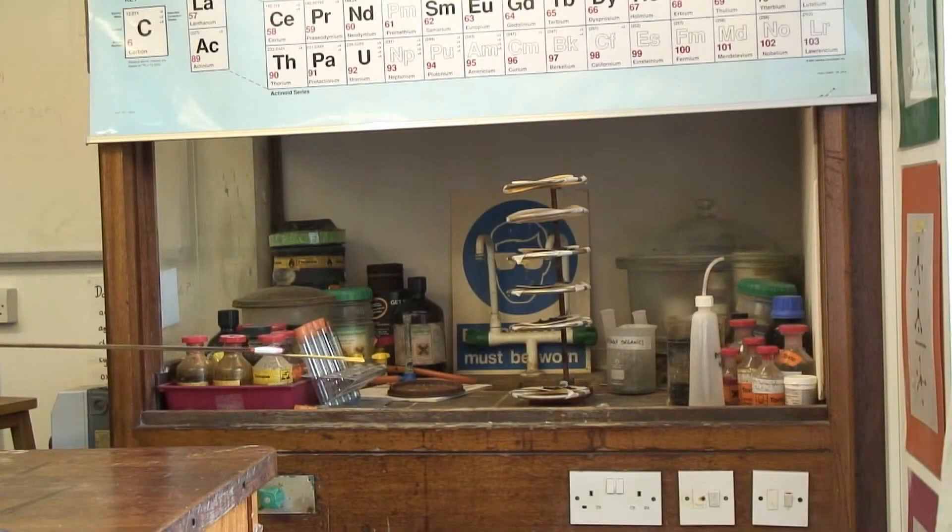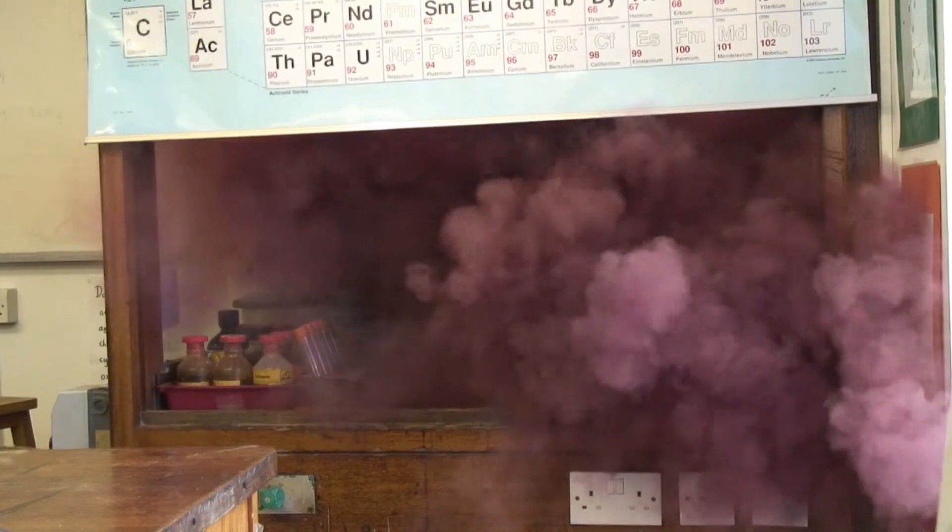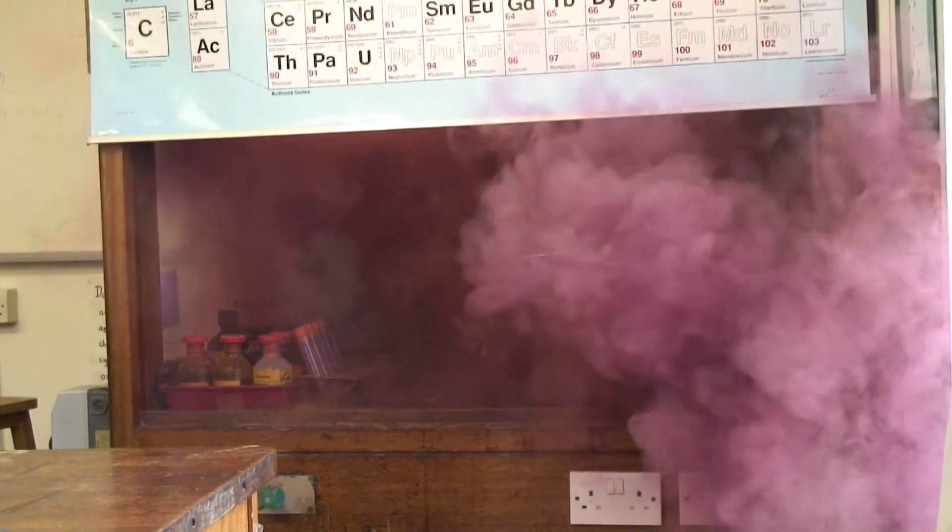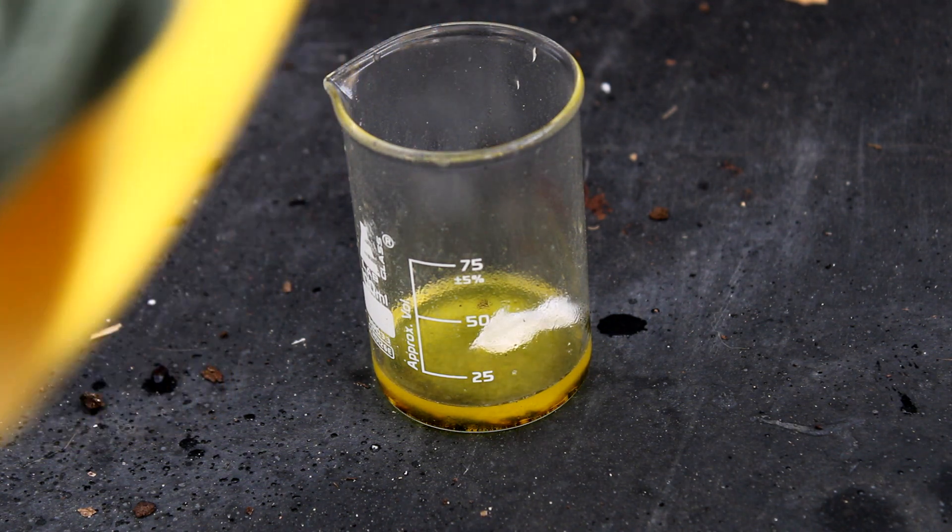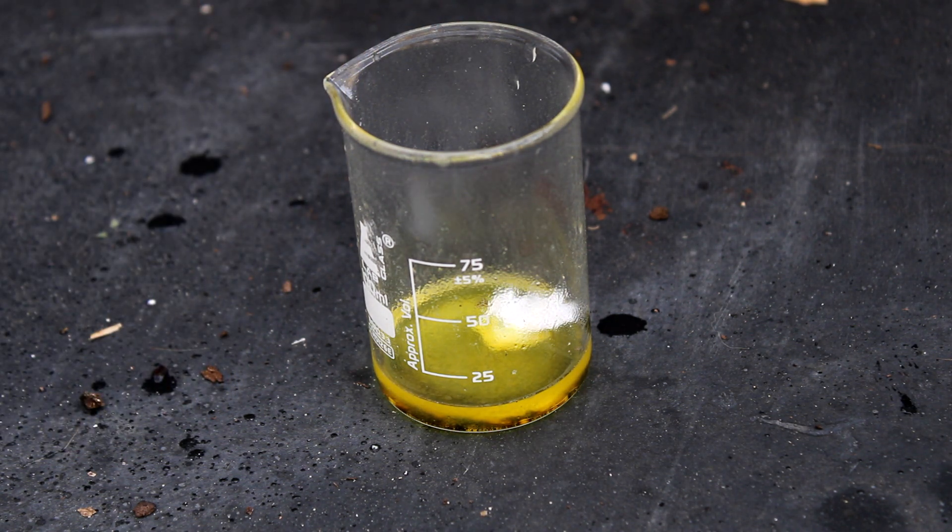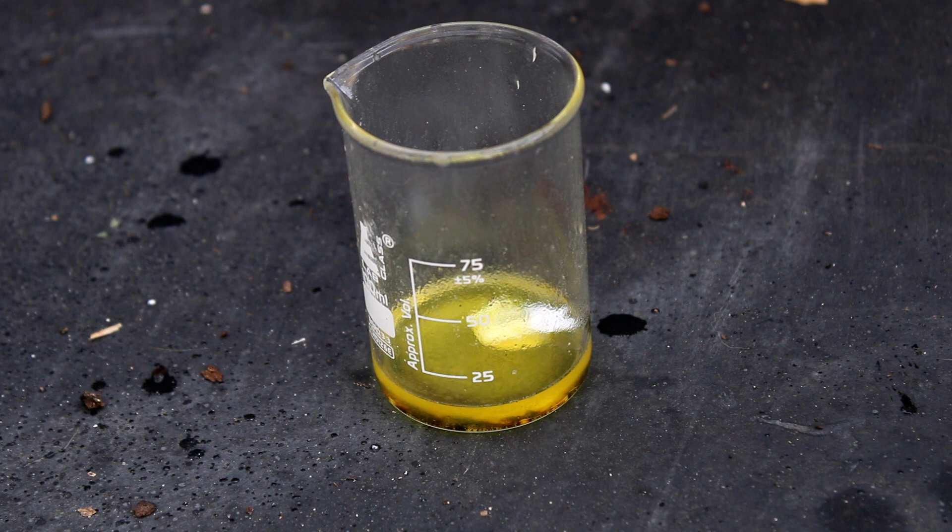In the world of chemistry, there is a list of chemicals that are considered too dangerous to have a practical purpose. Right up there on that list is chloric acid. Of all the chemicals I've worked with, chloric acid is by far the most unhandleable and unpleasant of the bunch. I could just tell you with my reasoning behind this statement, but why tell you when I can just show you?